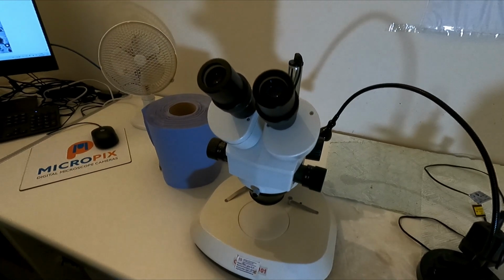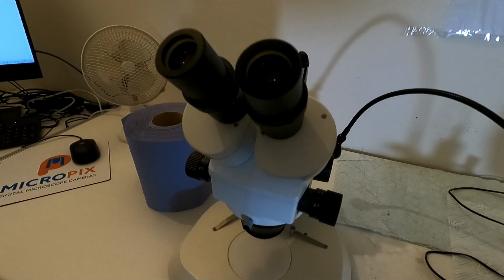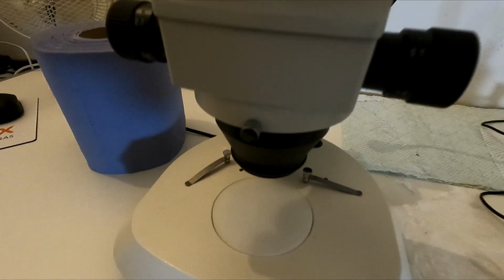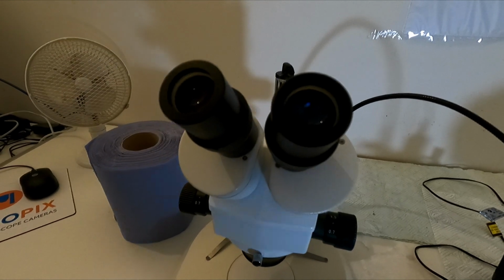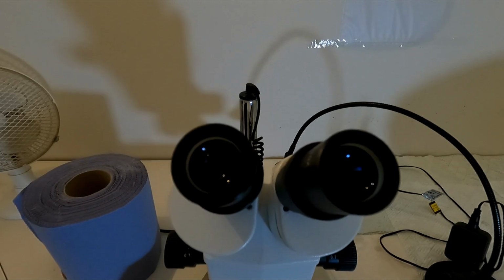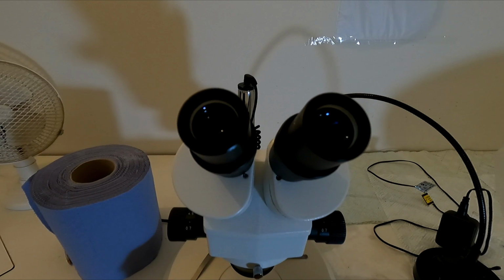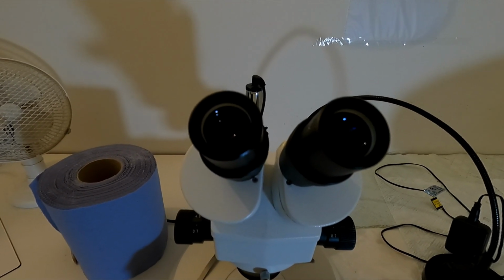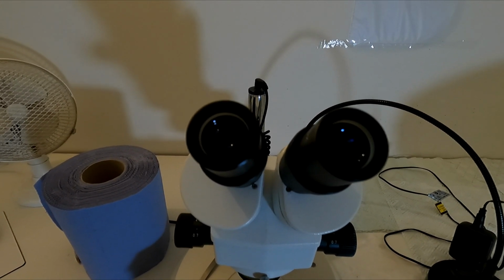We also have a secondary microscope, which is this one. It's called a stereo dissecting microscope. Slightly different construction, doesn't go anywhere near the same level of magnification as the other one I showed you, but this is useful for looking at organisms like nematodes, which are small worm-like creatures that relate to, feed on, and interact with the bacteria, fungi, the plant roots, as well as each other in the soil, and they can be quite useful in turning over organic matter into natural nutrients as well.